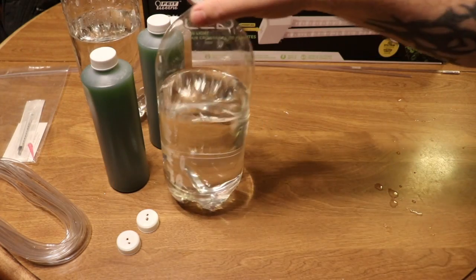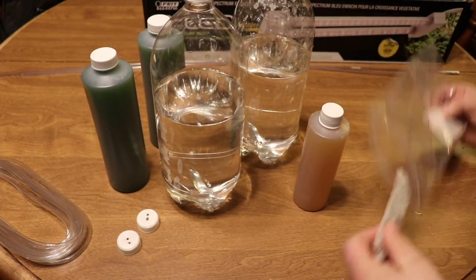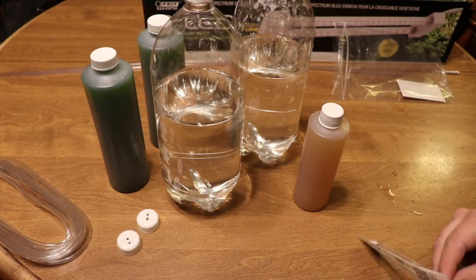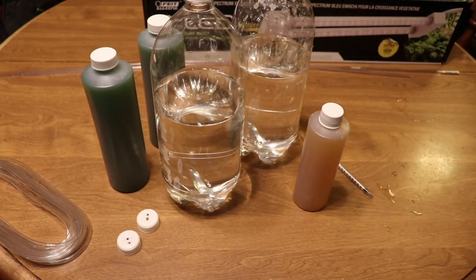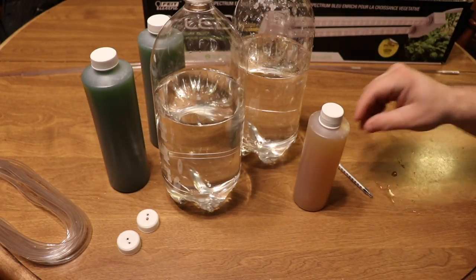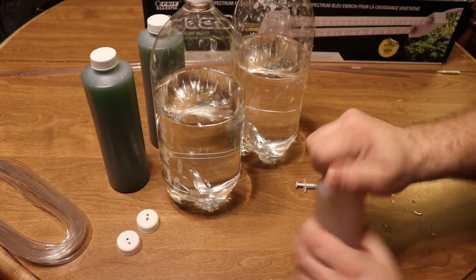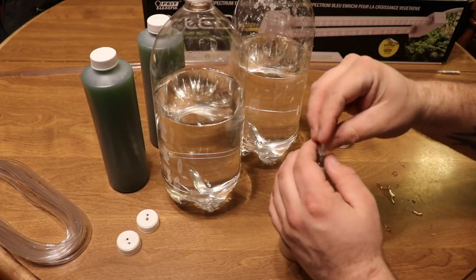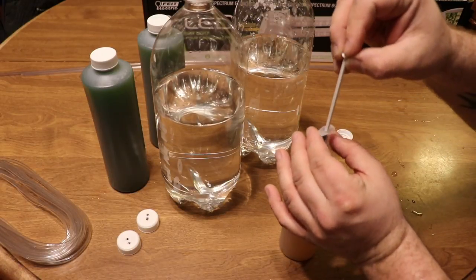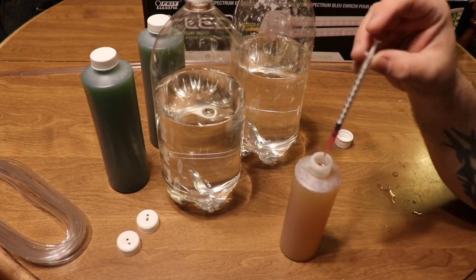What I'm going to do now is take the F2. I'm going to put a little bit more F2 than I normally would, just to kind of supercharge this phytoplankton a little bit. Typical dosage is two milliliters per four liters of F2. I've always kind of overdone it, especially when I'm starting a culture, because I really want it to be successful. Directions on the F2: shake it very well before use. What I just put in there was enough for a two-liter.